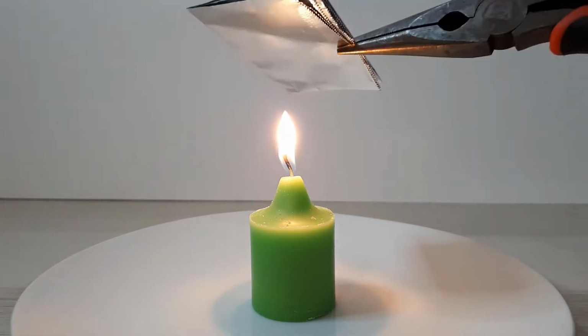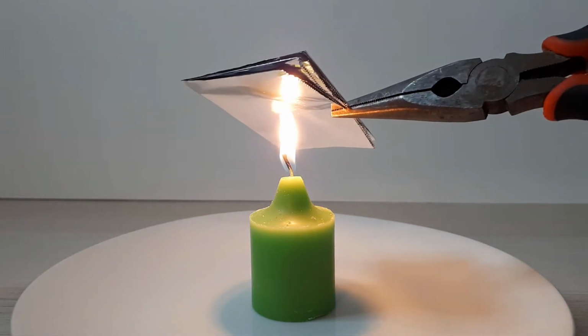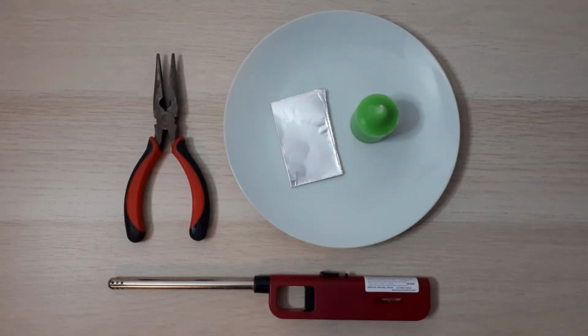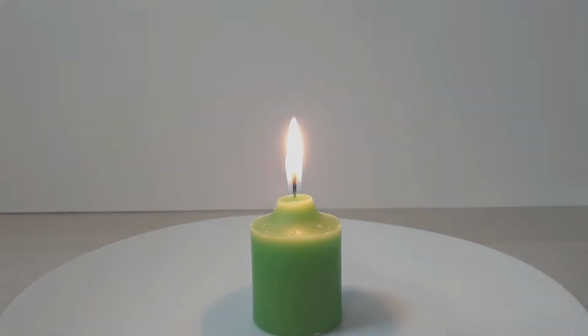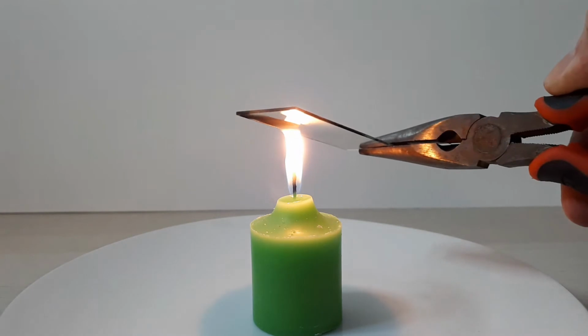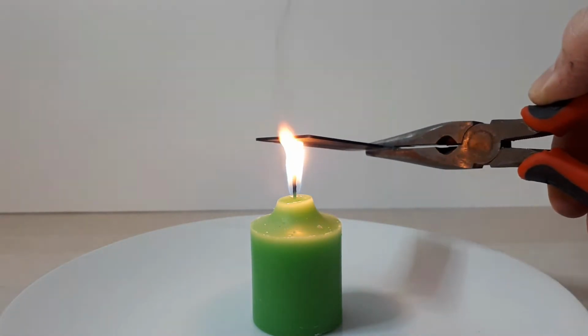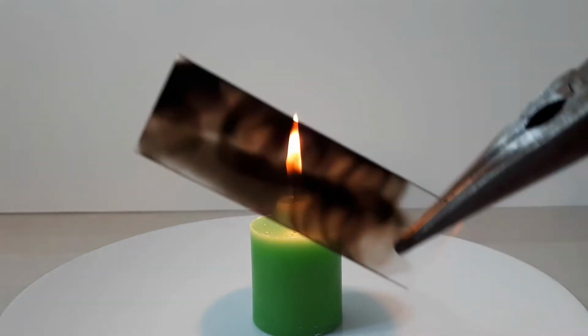Ignite a flame fueled by oil or wax, and hold an object barely within the flame. For this demo, we will need a candle, a lighter, the material you wish to deposit the lamp black onto, and pliers or tongs. As mentioned previously, all we need to do is ignite the candle and hold our material only slightly above or even within the flame. The longer the object is held near the flame, the thicker the deposition will be.